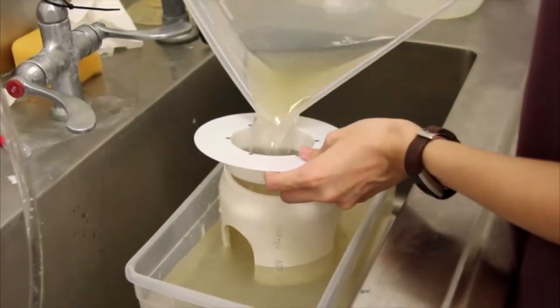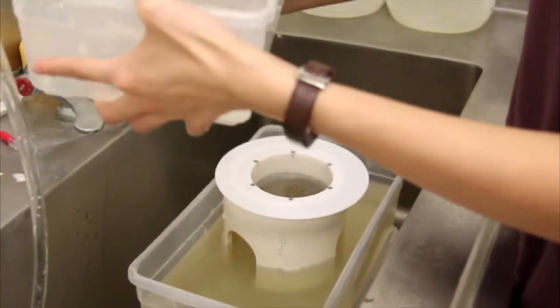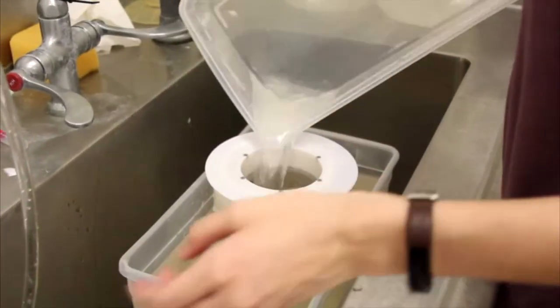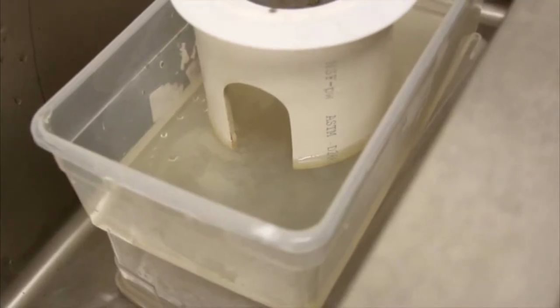Pour the larva and pupa through the strainer with another pan on the bottom to catch any larva that may have passed through. The pan can then be refilled with DI water. Make sure to double check that the water has no small larva that pass through the strainer before disposing of it.